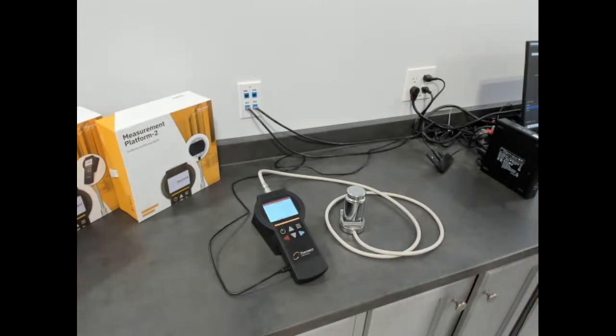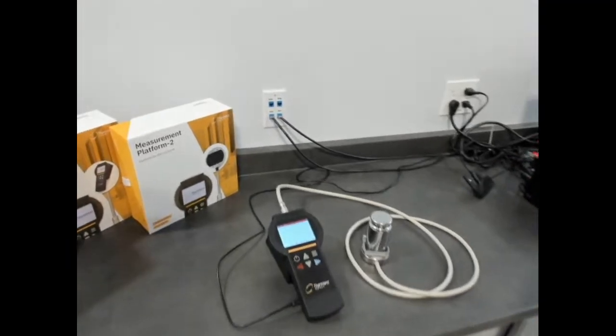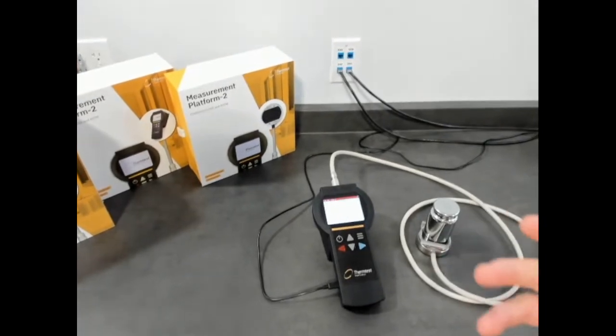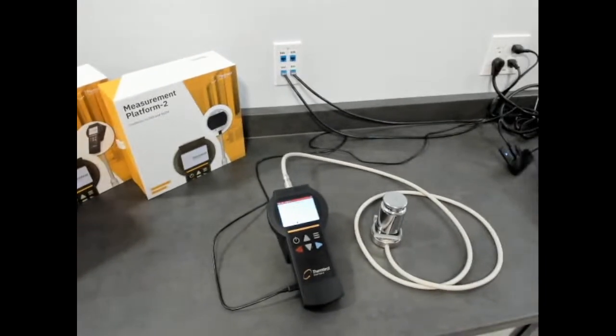So here you see the transient of temperature rise versus time. Well, you might be able to see it. The camera angles might not be great. We'll lift that and bring it to the camera as soon as it's complete. We don't like to disturb it while it's actually running a measurement because that might move the sensor and generate erroneous data. I think in this case that's a 40-second measurement, sorry.